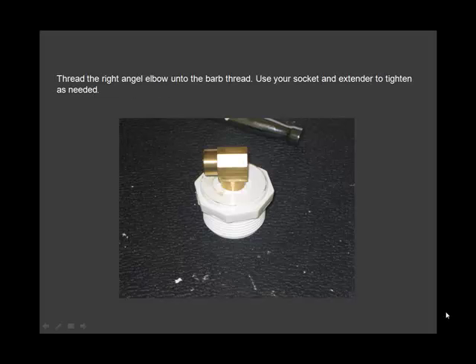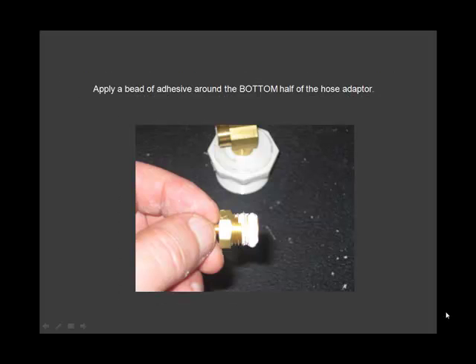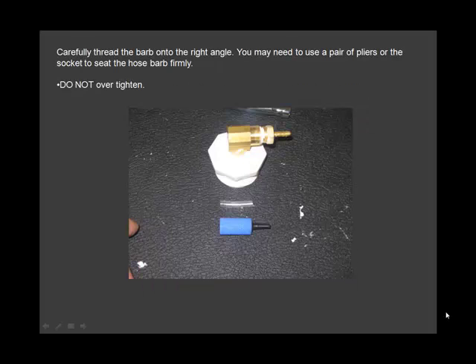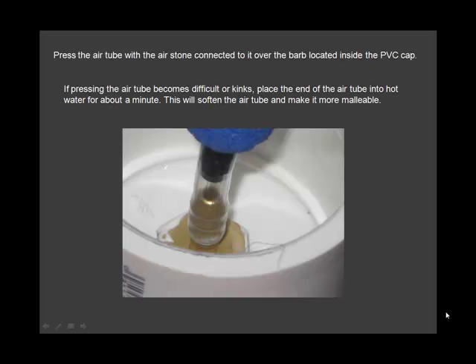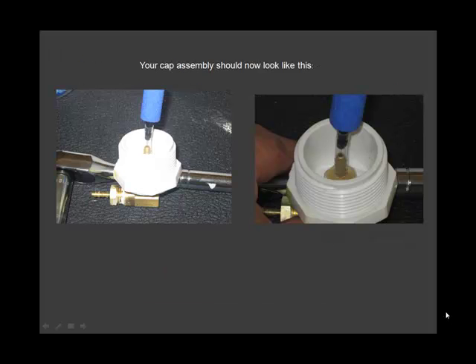Thread the right angle elbow into the barbed thread. Apply a bead of adhesive. Carefully thread the barb onto the right angle. Cut a piece of tubing. Press the air tube with the air stone connected to it over the barb location. Your cap assembly should now look like this.